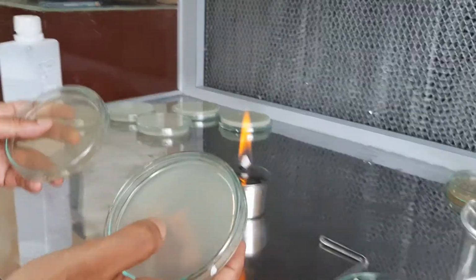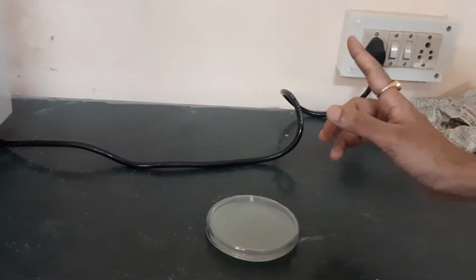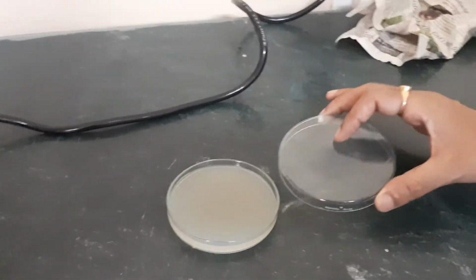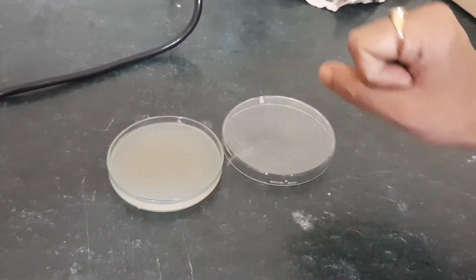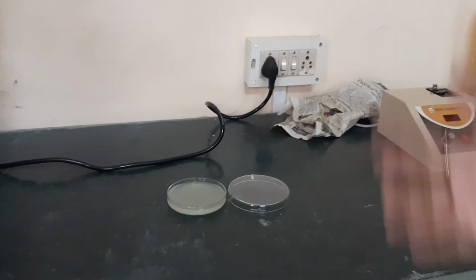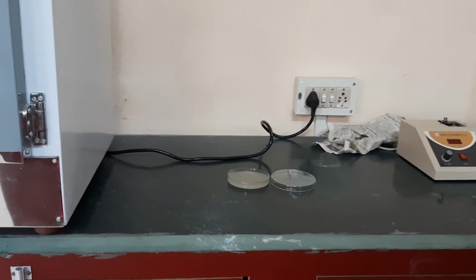Let us now see where we can place this. This is the laboratory rack, nearby the incubator. We want to see if there is any higher microbial load in the air. So we will place it here and leave the lid open for half an hour, and after half an hour we will close the lid and incubate it. This can also be practiced after fumigation of laboratories and hospital rooms. Once we have fumigated, if any microorganism is left, that can be checked with the help of settle plate technique.